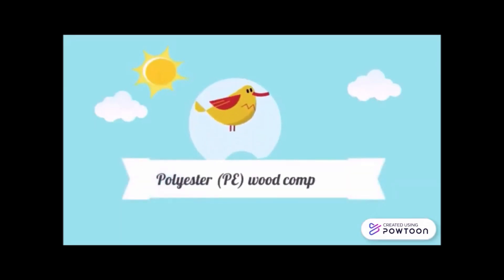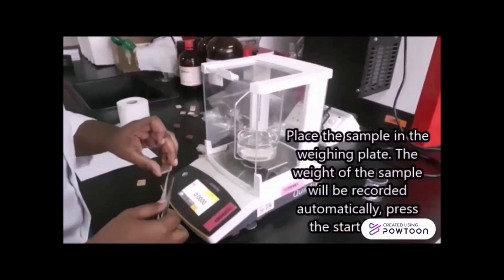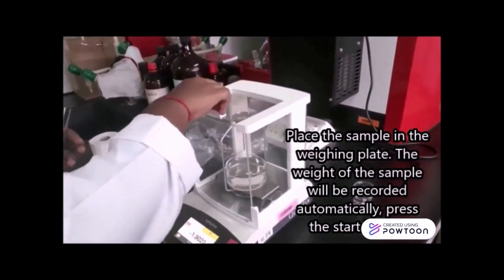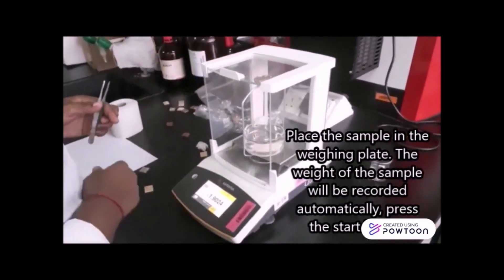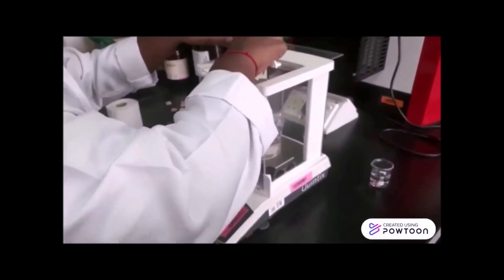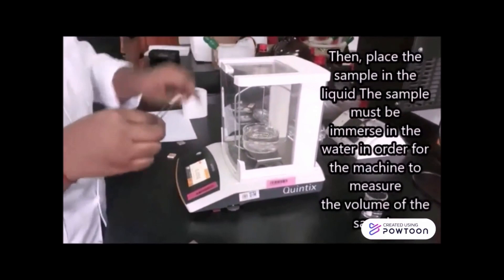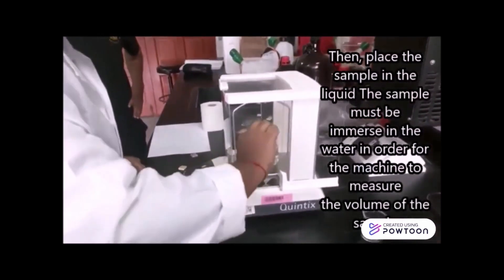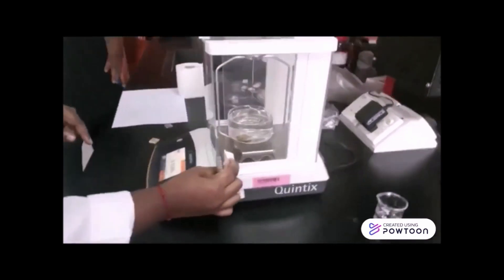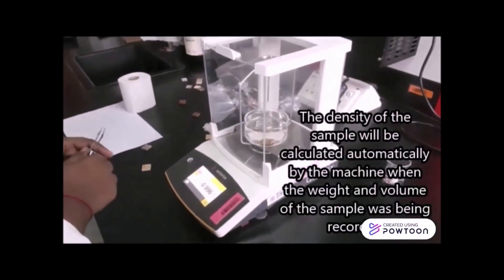Next, we repeat the same steps for the polyester wood composite. Place the sample on the weighing plate to measure the weight and press the start button. Then place the sample in the liquid. Remember, the sample must be fully immersed in the water. The value of density is recorded after it is calculated by the machine.